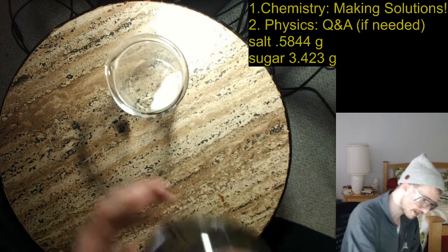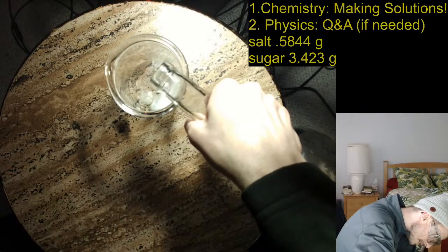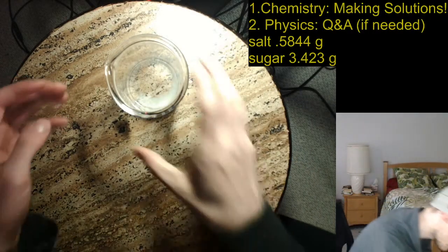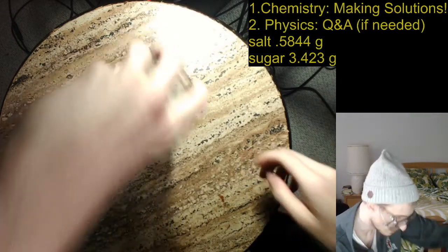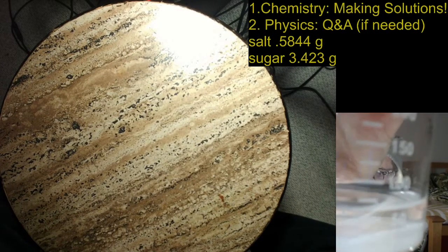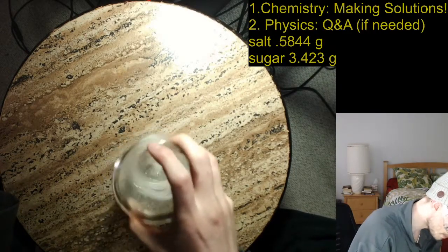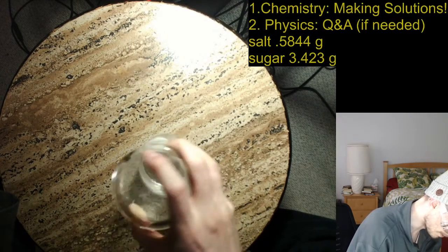So I have my handy dandy water here, and for now I'm just going to add up to maybe 50 or so. Maybe 75. 75 will do. So I've added about 75 milliliters of water. You can't really see, but maybe you'd be able to better see in this camera here. A little bit less than 75. And there's nothing exciting about this part. I'm just going to try to dissolve this. Now, this might actually be kind of difficult because there's not that much water in here.